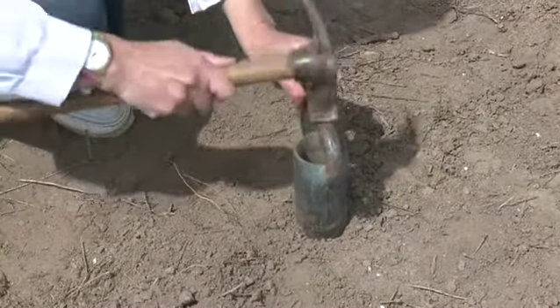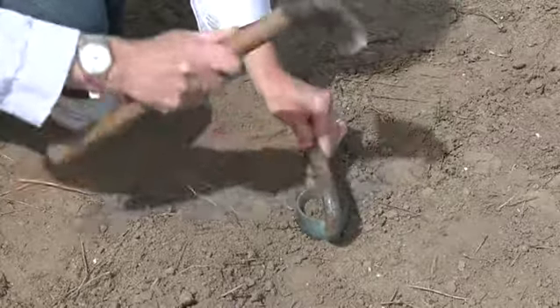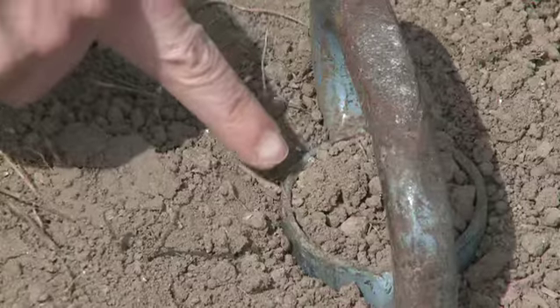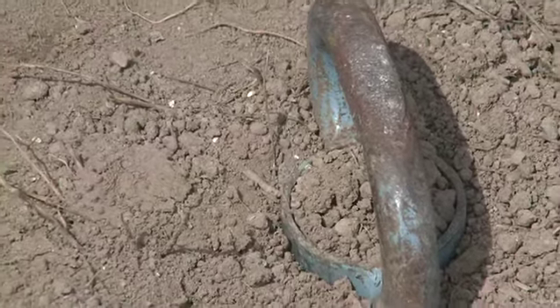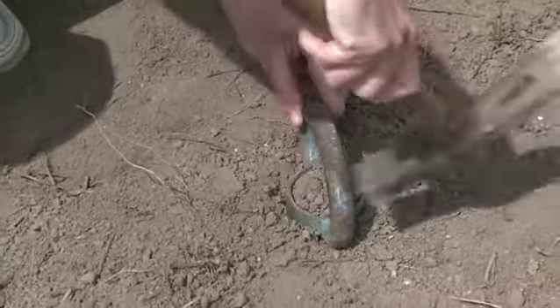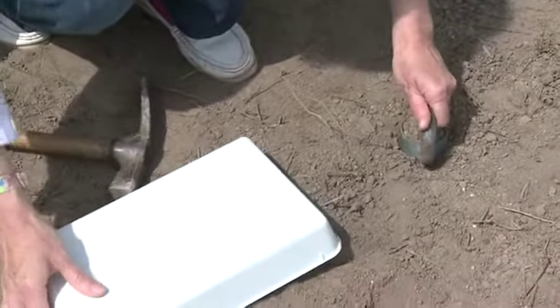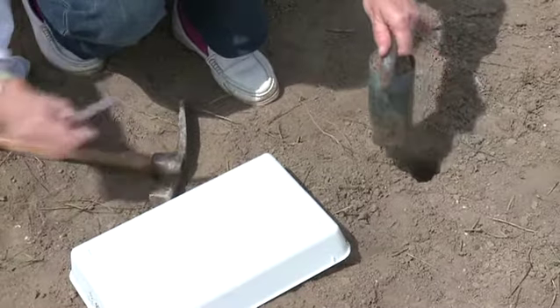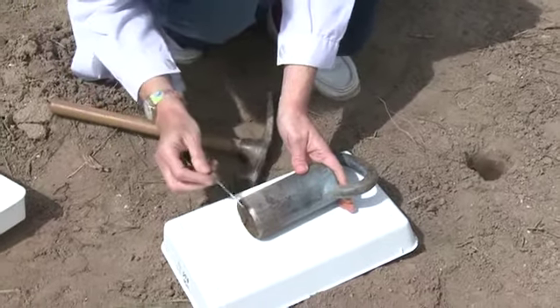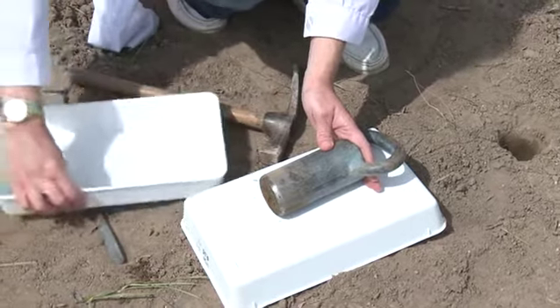To determine soil bulk density, it is necessary to have a tube of known volume with a sharp edge in the lower part. Such probes cannot be used on stony soils, though. With the help of a spatula, scrape off both the upper and the lower levels to obtain a known volume of soil.